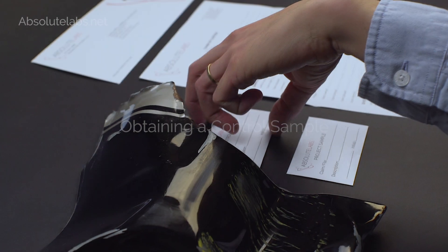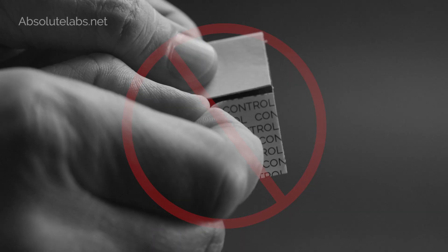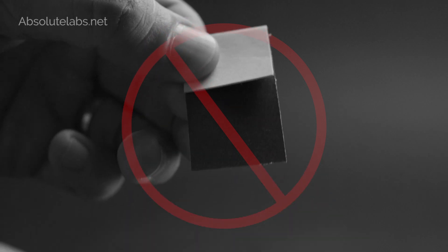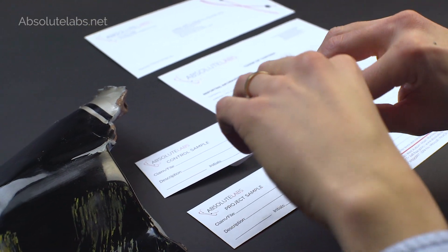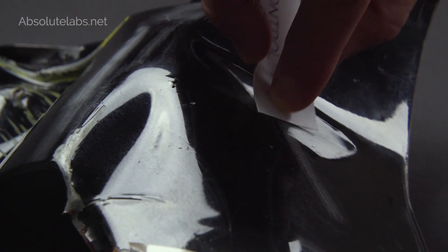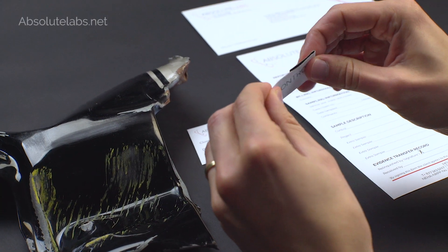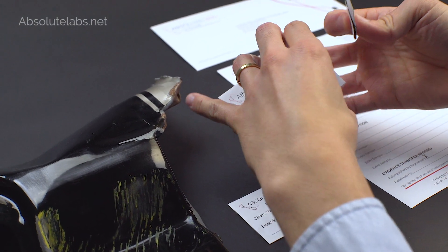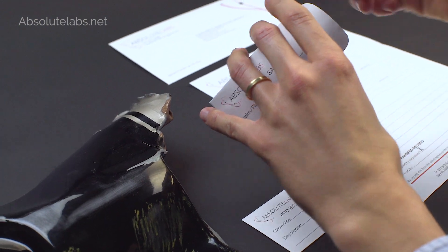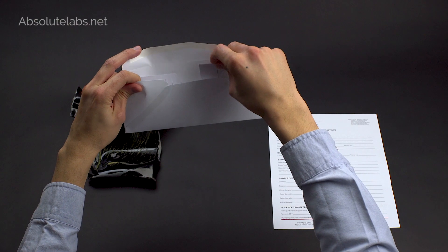Obtaining a control sample: Open the control envelope and remove the abrasive sampler. Do not remove labels. Hold the sampler by the sides. Avoid touching the abrasive sample area and lightly wipe across the surface of the undamaged control material. Fold the sampler back onto itself and return it to the control envelope. Fill out and seal the control envelope and place it in the mailing envelope.